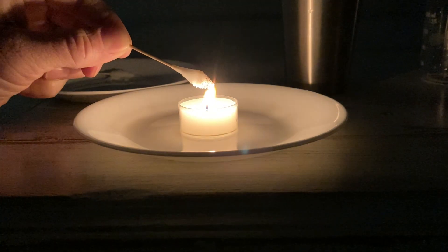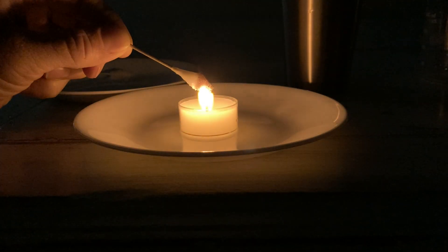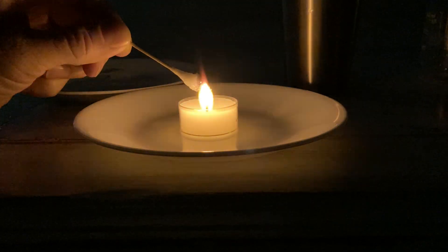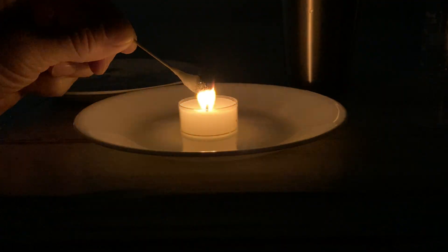You can see it — it's a real yellow-orange color. It's starting to burn my q-tip a little bit, but it's still yellow-orange. It gets a little more yellow than the actual candle flame itself. You can see that, right?